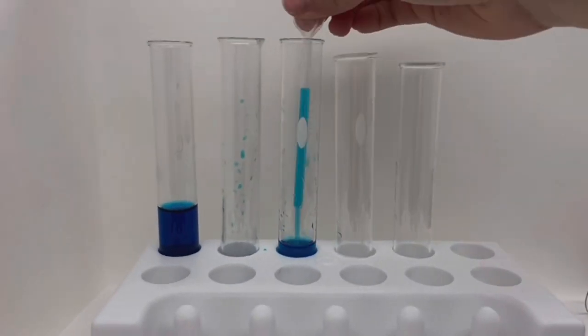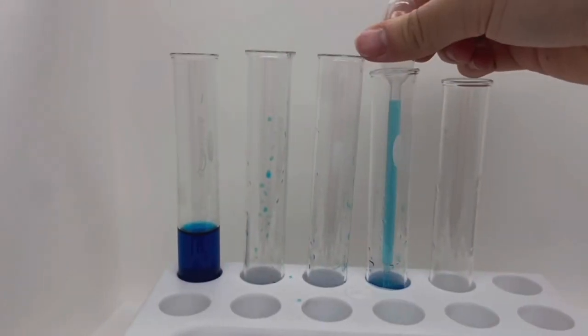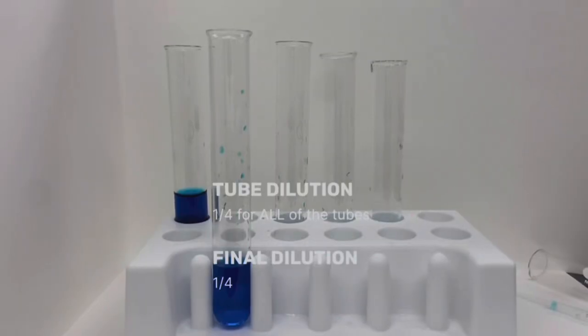To find the final dilution of each tube, all you have to do is multiply the tube dilution by the previous final dilution, as shown below.